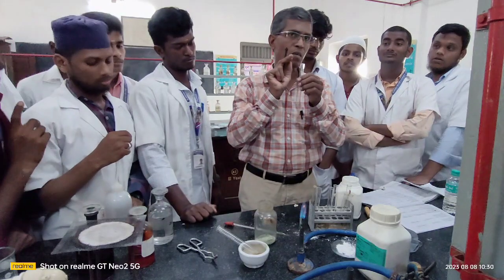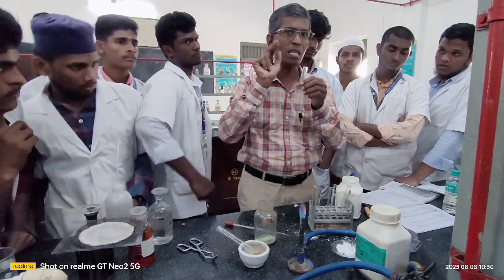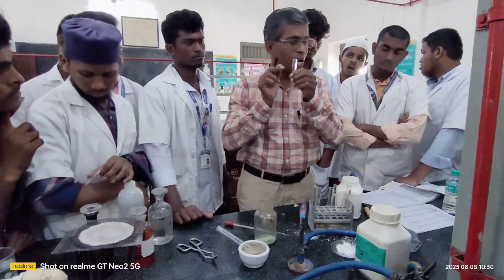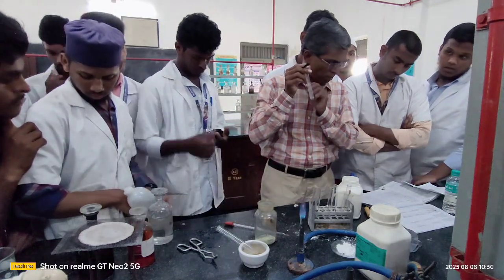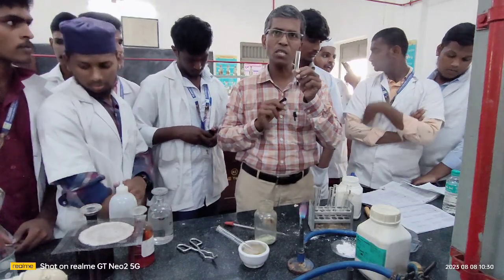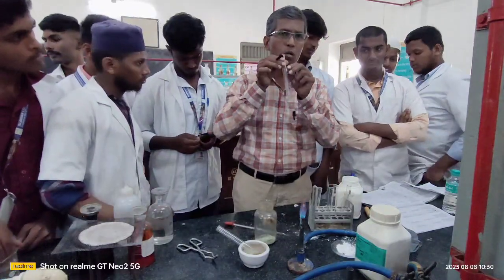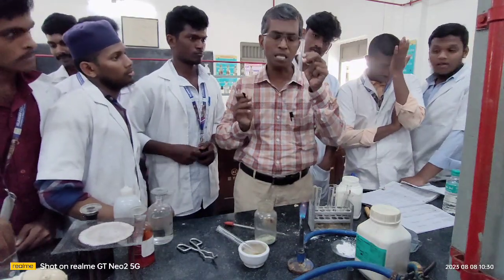Remember, this is one confirmatory test. Don't think that this is the only confirmatory test. We have one more test. I will show you how to differentiate, because the same silver mirror test is also given by aldehyde. You will encounter the same thing. Aldehyde also responds to the same test, and carbohydrate also gives the same test. Anyway, I will show you how to carry out the formation of the silver mirror in this test tube.